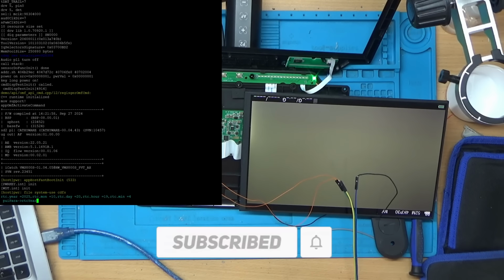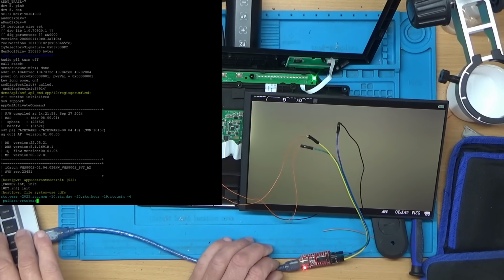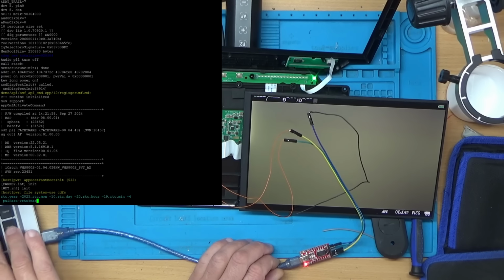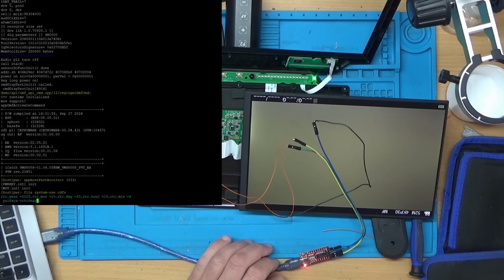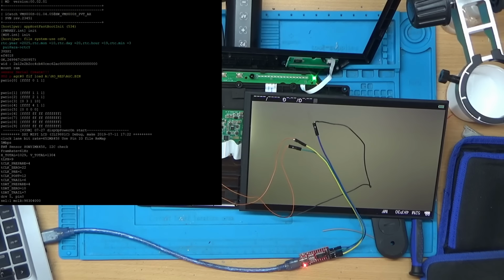I'm just trying a few different keys on the laptop here just to see if we get any response back. But it doesn't seem that we are. I'm actually sending data there when I press a key. You can see the light flickering on the adapter just there. So it doesn't seem like it's receiving any data from us, but let's have a look, because the console here might be disabled.